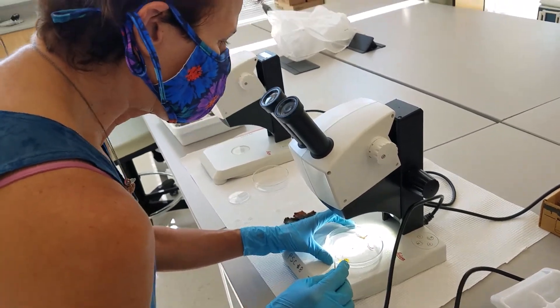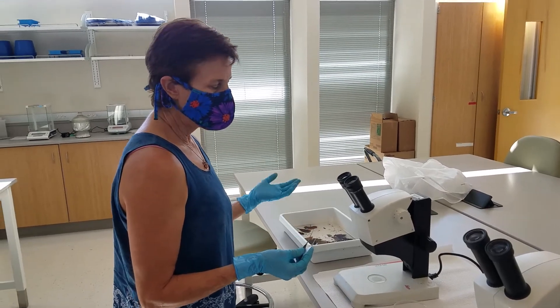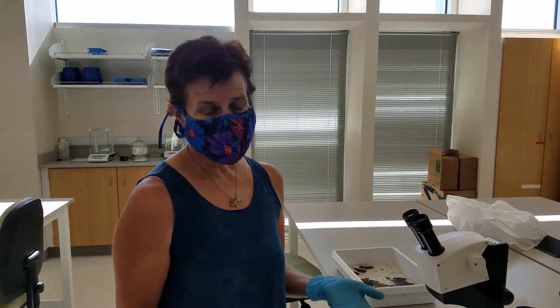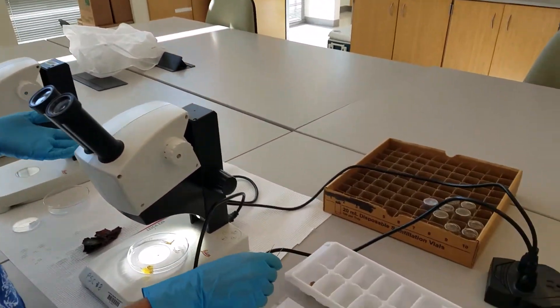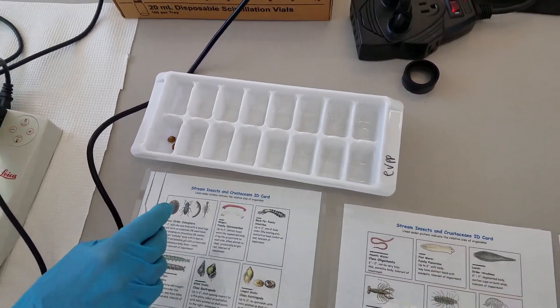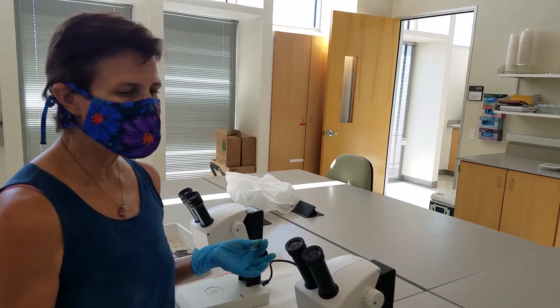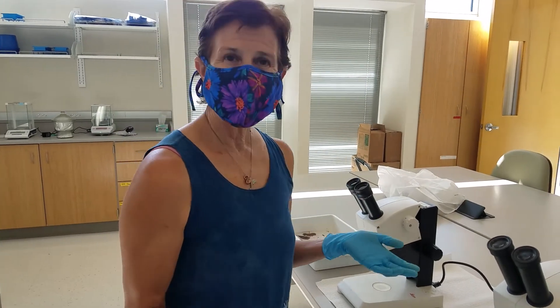Basically a group of four or five students would take a set like this, sieve it a little bit more, and then go through every little piece of this sample to ID the critters and count them. You would start with this and move the common critters into sorting bins in the ice tray, then transfer those into a vial where you can look at them again and recount them. It's better to count them now, and then you can do an assessment of stream health. That's the essence of the procedure.